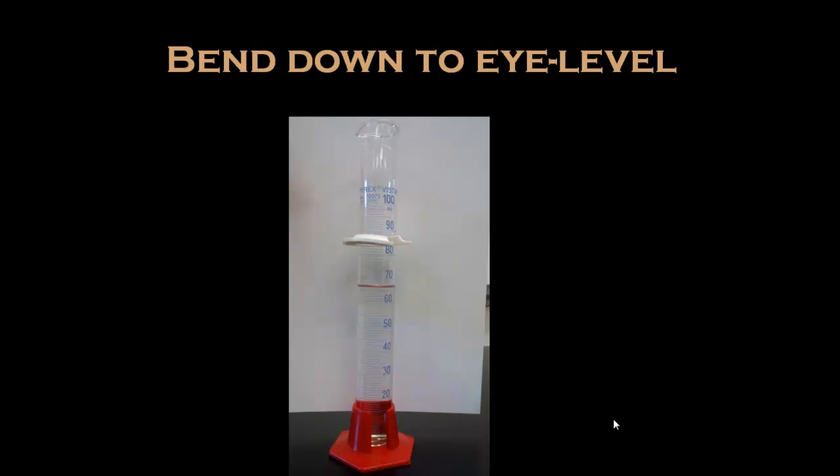Next, bend down to eye level. It's very difficult to read the container if you're looking from a high angle or a low angle, so be sure your eye is at the level of the liquid in the container.